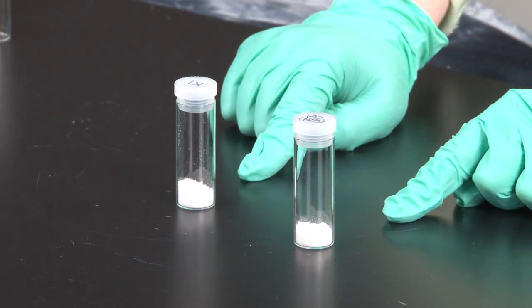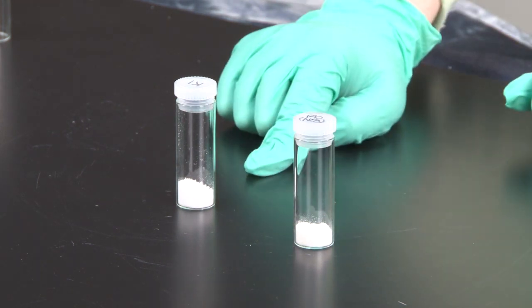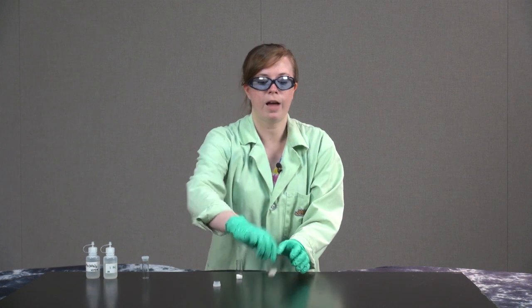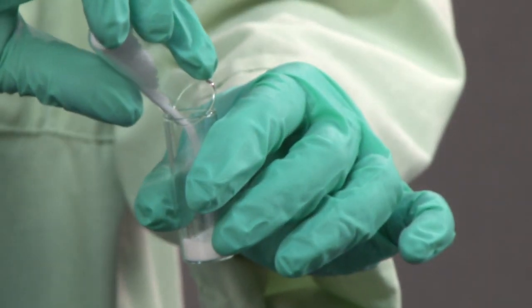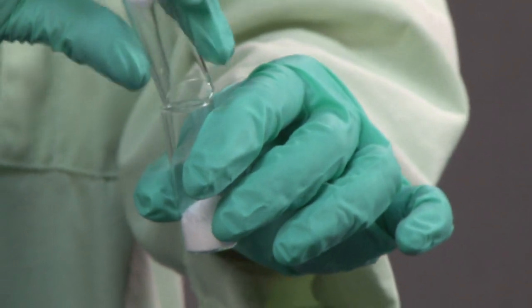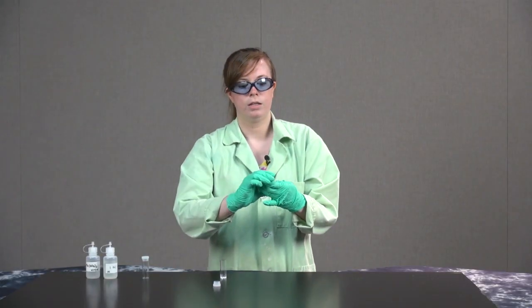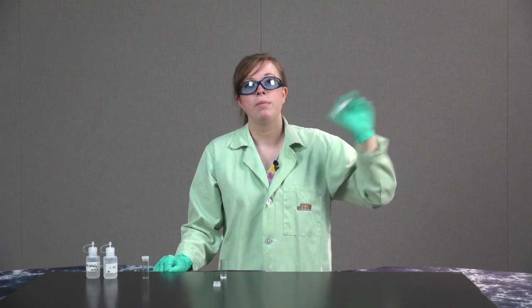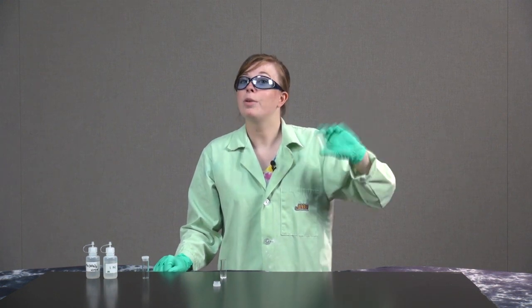Here I have two white solids. The first is lead nitrate and the second is potassium iodide. I'm going to combine these two together in the same vial, and then I'm going to shake. By shaking, I'm inputting mechanical energy, and so this is going to be a mechanochemical process.